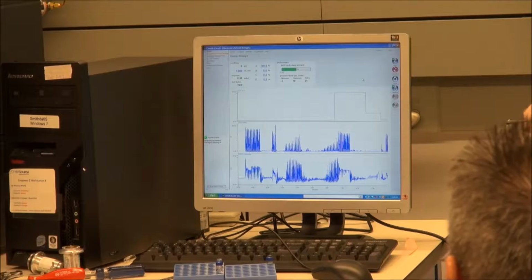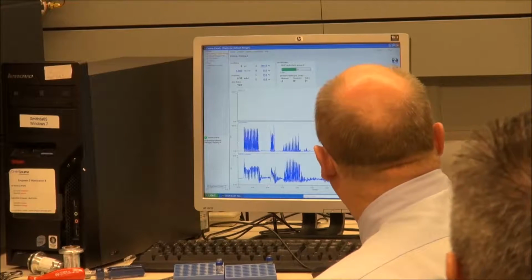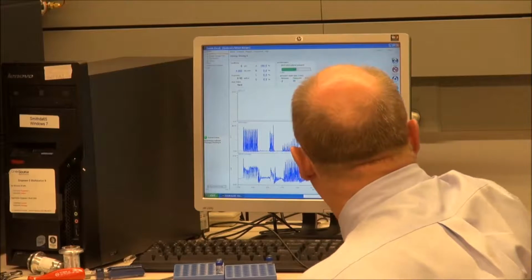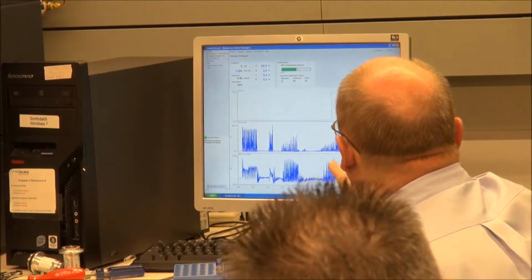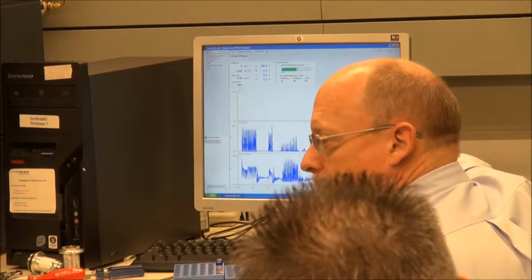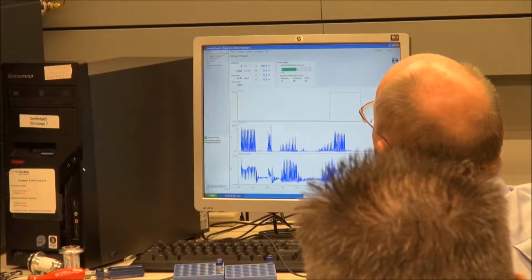That will prime quickly if everything else is alright. So you see this is what it looked like before, and now it's starting to clean up much like this one did. We see nice even primary strokes going from almost nothing to almost the whole.